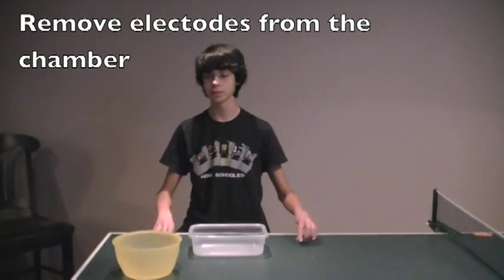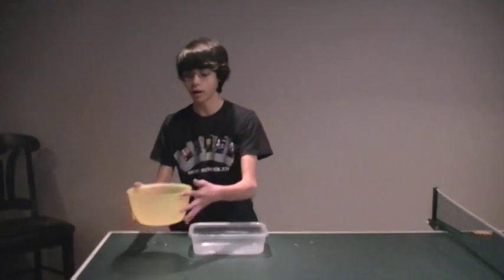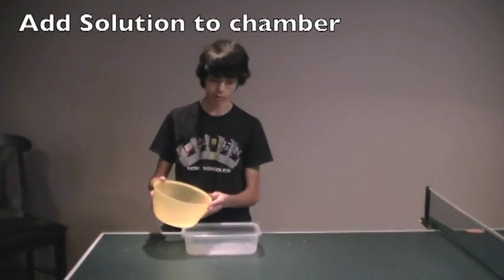Remove the two steel wires and add your solution into the chamber.